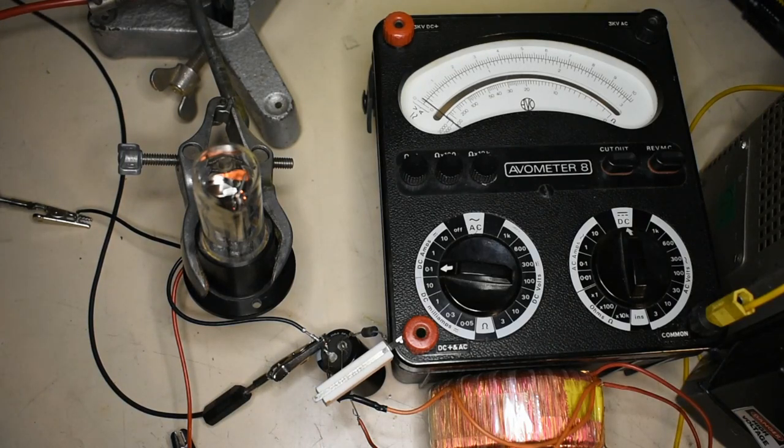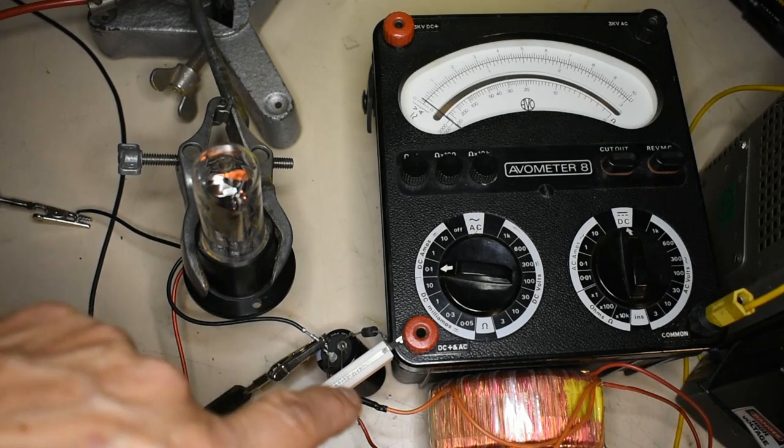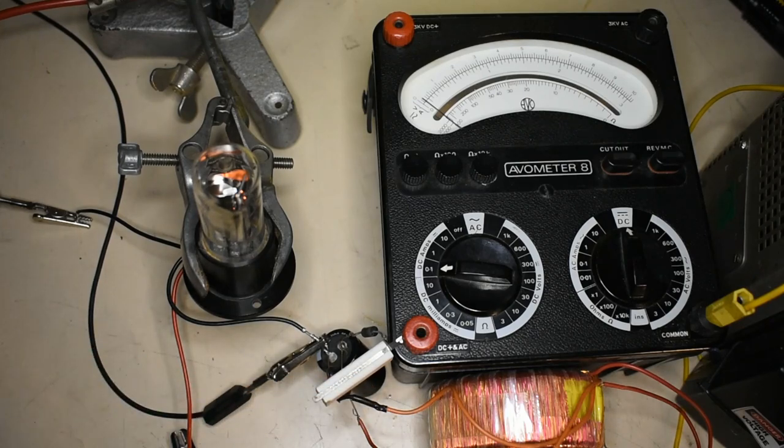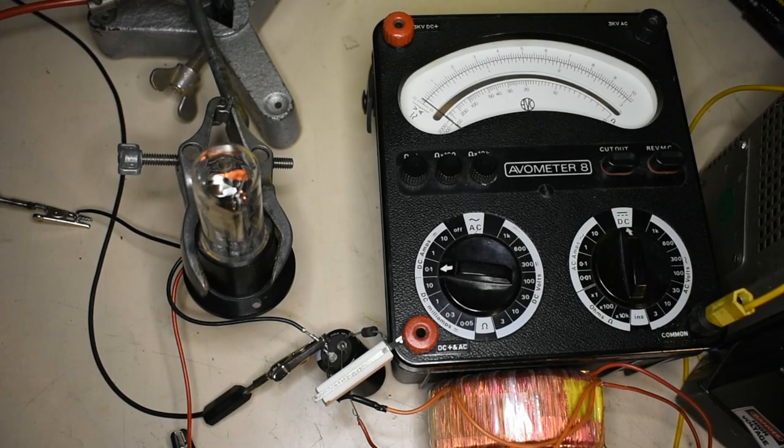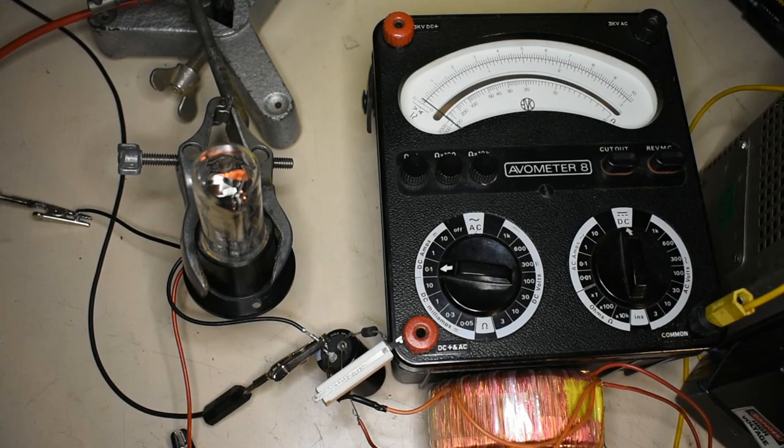Normal running current for this type of lamp is around about 300 milliamps and I have a ballast resistor here just to limit the current. So I'm going to also apply a high voltage pulse onto our anode which is about 1 kV and hopefully this will light.